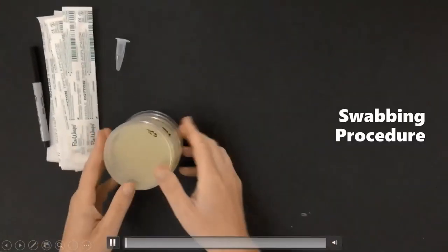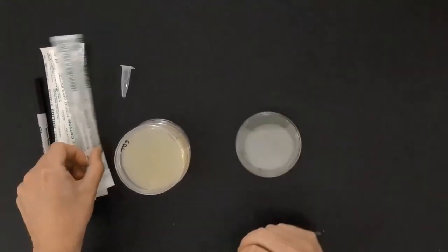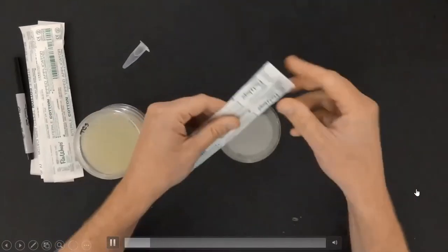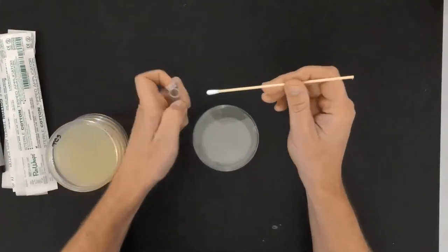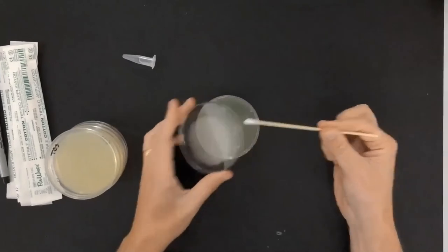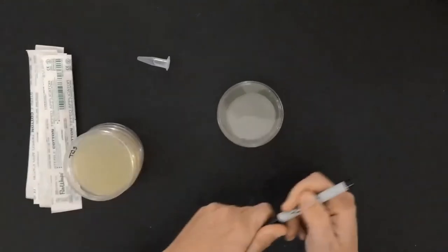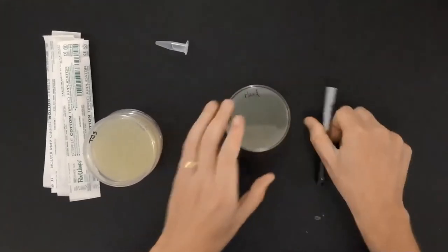What I have here is a stack of agar plates — basically a petri dish with some agar media inside. I also have some cotton swabs and some saline solution. I'm going to swab the palm of my hand, get the swab wet with saline, swab the palm, see if I can get some bacteria off of it, then smear it across the agar. I'll label that plate as 'hand.'